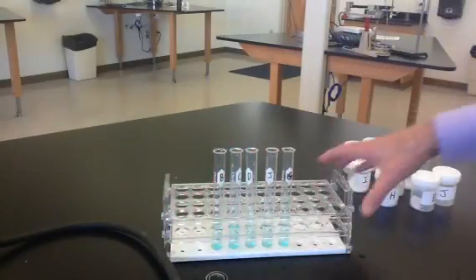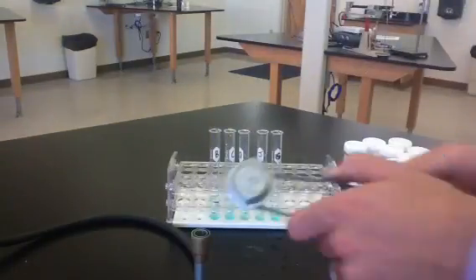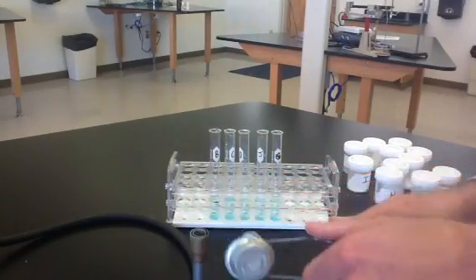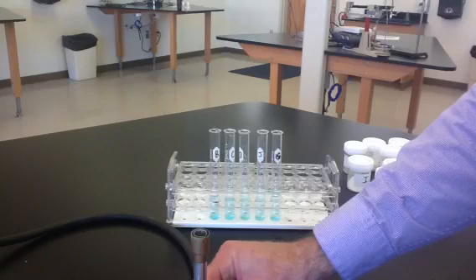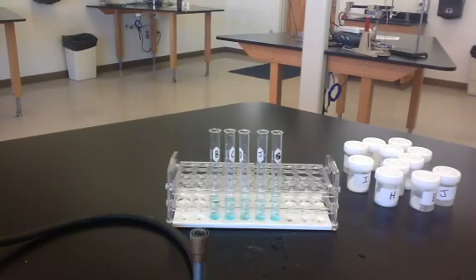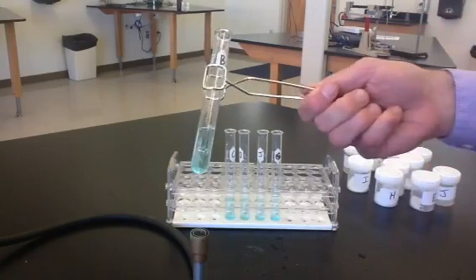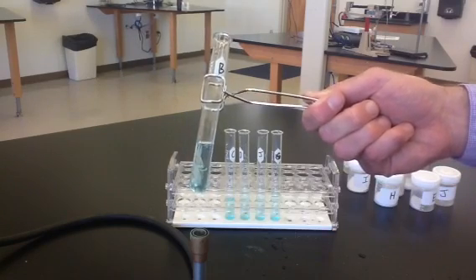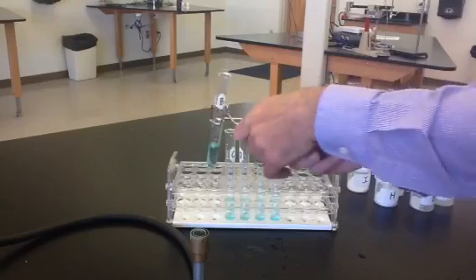What we need to do next is heat the solutions, so we're going to light our Bunsen burner. Now we're going to heat each of these and see if any changes occur. We'll start with B — heating this in our Bunsen burner, looking for color changes that may occur. We don't really see any color change with solution B.